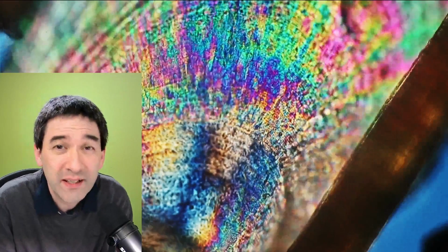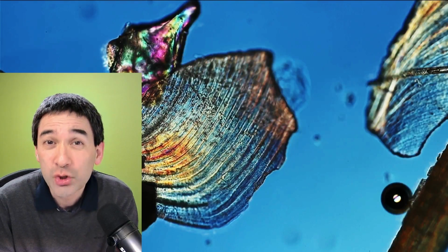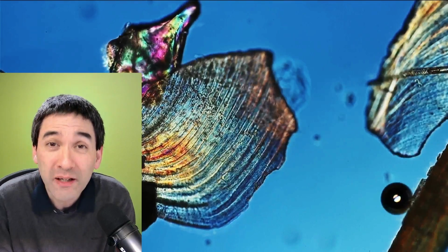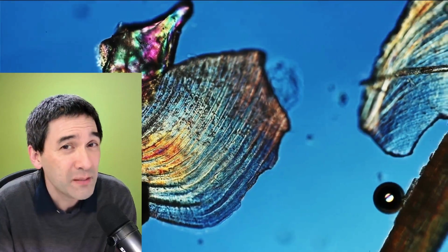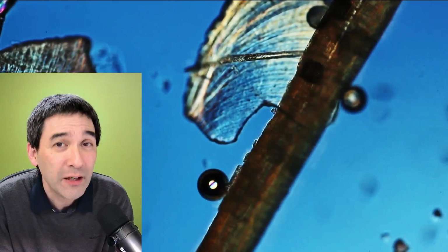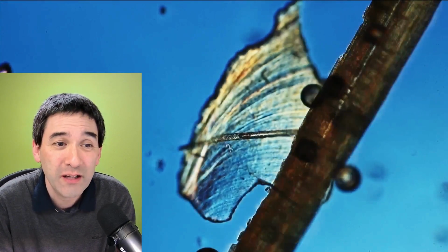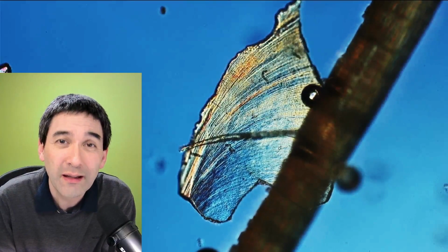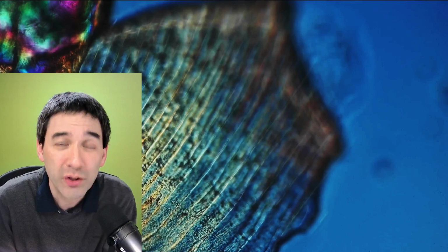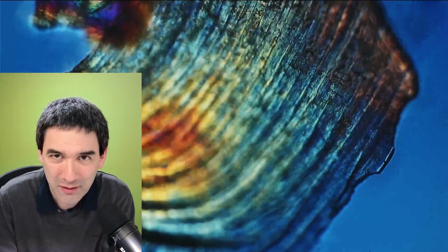So how can you find that out? Well, fish scales are made of collagen, which is a protein, while the shells of a clam are made of calcium carbonate, and they're pretty hard and brittle. By doing a simple chemical reaction, we're able to find out whether it's indeed calcium carbonate. So, for example, here's another one, and you can see that those rings are like tree rings. As the clam grows, it deposits one ring after the other, maybe once every year. I did find out it's actually the shell of a clam and not the scale of a fish.